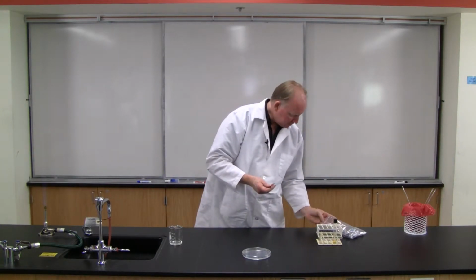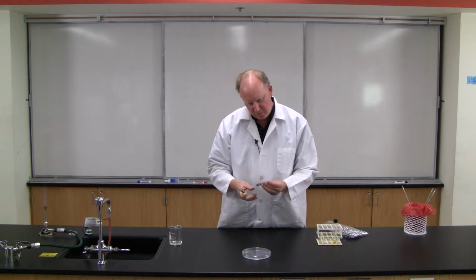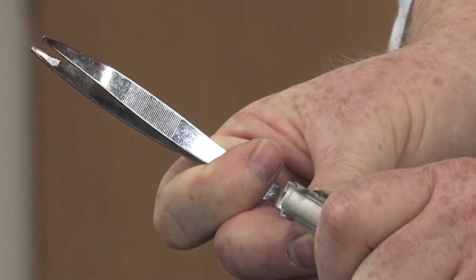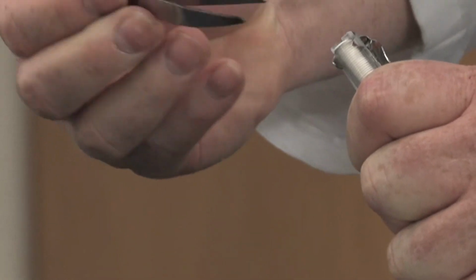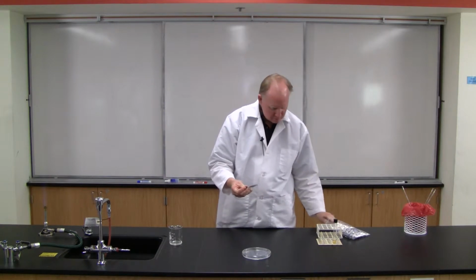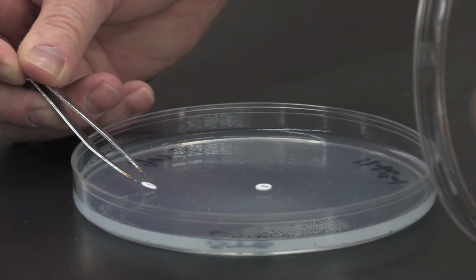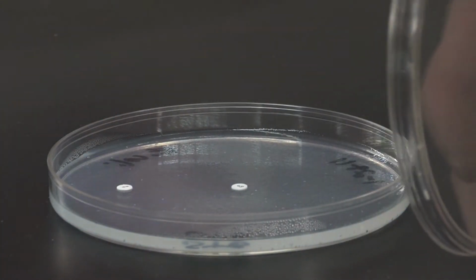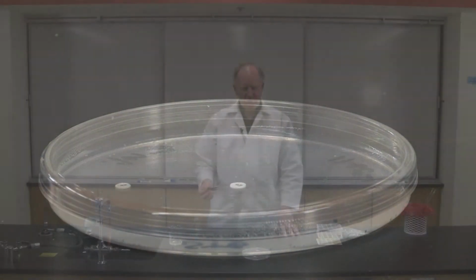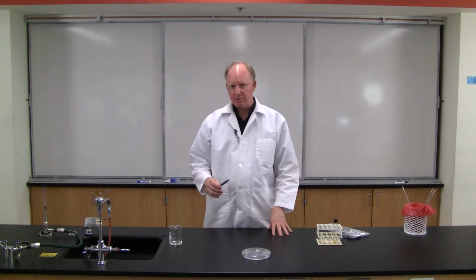Now this one doesn't have one of those little metal ejectors. Let me get a different one here. All right, so we have erythromycin here. And once again, use this little device to push the disc, grab it with the forceps, and I'm going to place this one about right here. Gently press and so forth. So I'm going to do that for another 6 antibiotic discs, and when I'm finished, you'll see how they're arranged in such a way that they're as far apart from each other as possible.